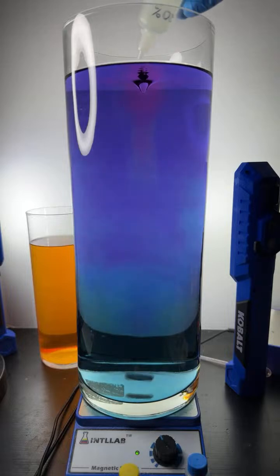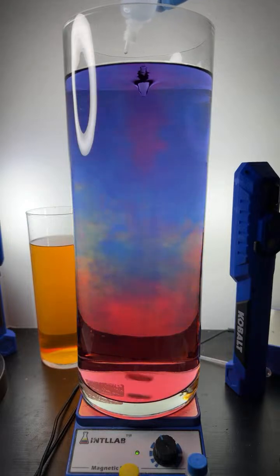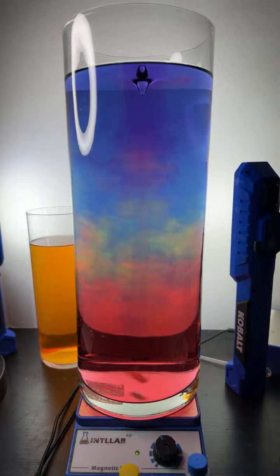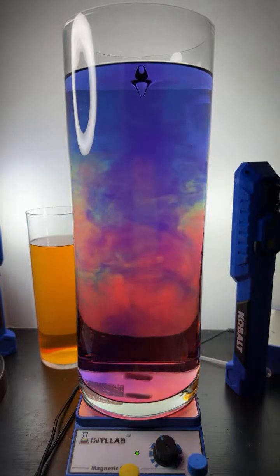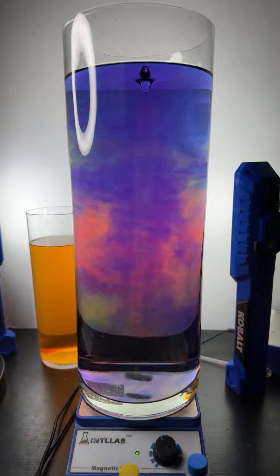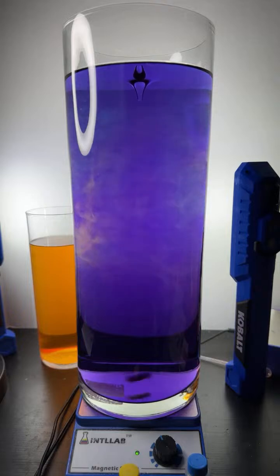So right now I'm adding acid at the top. And that's going to cause shifts to red, oranges, and yellow. Yeah, that's what you can call it, Shrey, the ultimate indicator. I'm going to start adding some base now because we're getting a nice red color developing. I'm chasing it with a bit of base. I'm doing all right, one chemist. Thank you there, Supra. And it is beautiful when you get the entire rainbow of colors showing up at the same time. That's kind of my favorite.